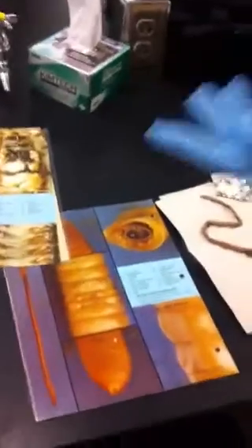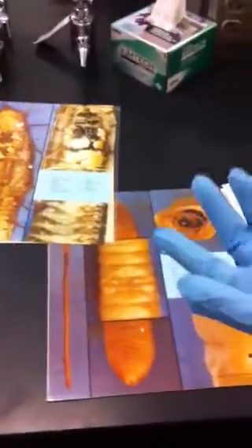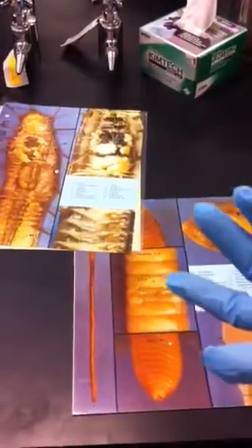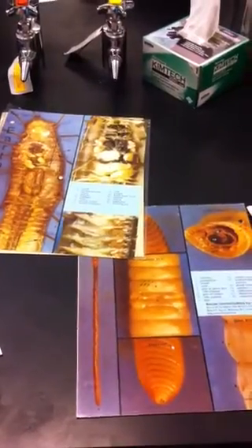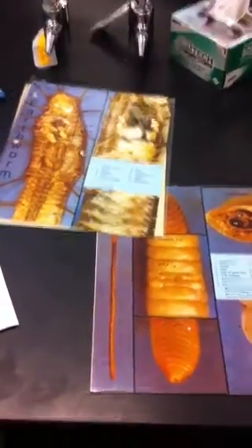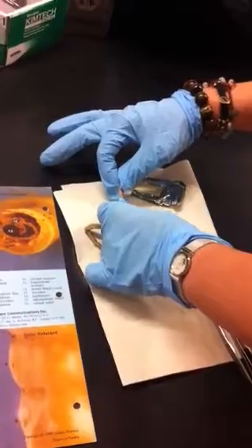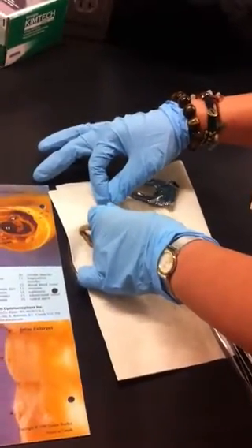Okay. For key thing with this one, let's go and kind of look at it. You now have more systems. Okay, so what phylum again? Annelida, right? And this is what we call the true segmented worms. And if you look at them, they literally, right here, they literally look like segmented worms. They're not like the first one that we saw, which is the tapeworm. They kind of look like it, but they're not.